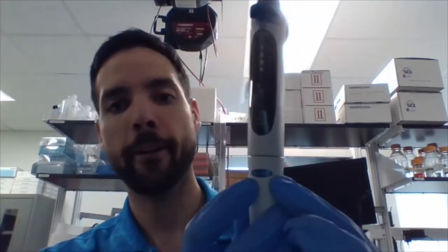How about this one? P1000. So P1000 tells me I can do from 0.1 milliliters to one milliliter. That is the same as from 100 microliters to 1000 microliters. So 0.1 milliliters is 100 microliters. And so 100 microliters, is that above, below? Is that close to my volume? How much did I want to pick? 50. So 100 microliters is the least I can pick up with this guy. So if that's the least I can pick up, 50 is under the value of 0.1 milliliters, which is 100 microliters. I cannot use this one.